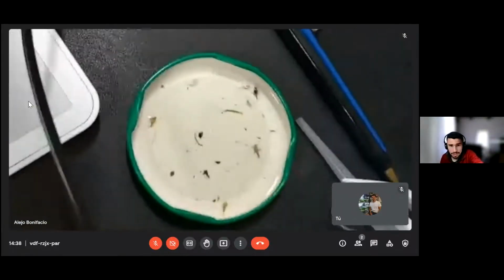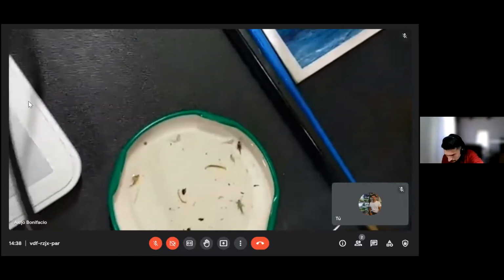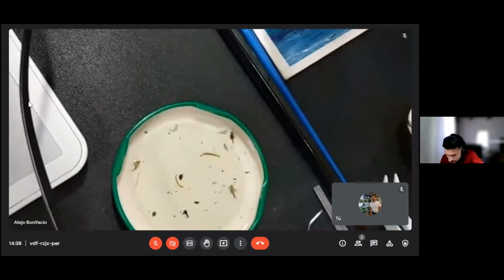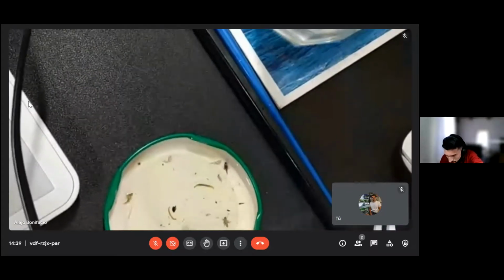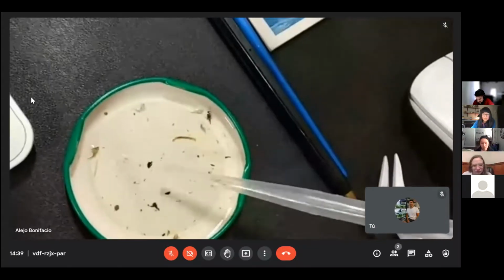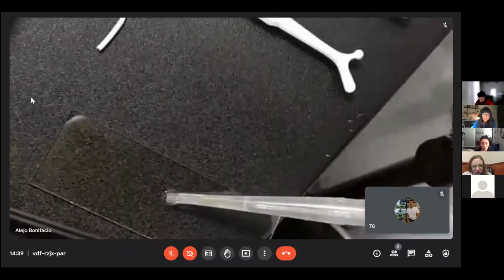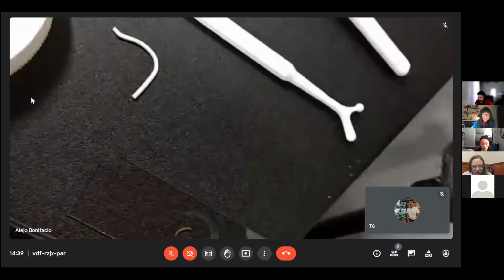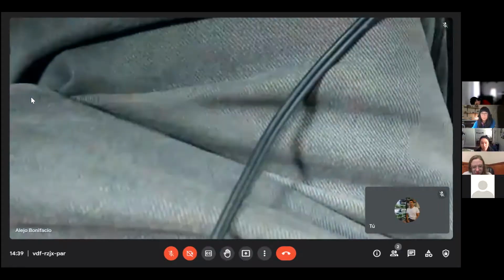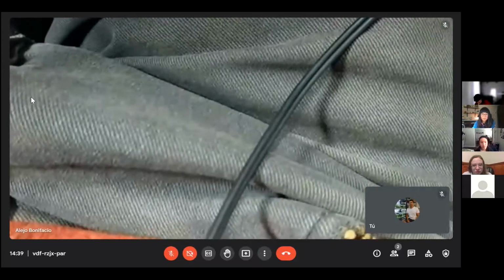These animals are preserved in ethanol, you know, and you will see that not all, but here there is a bloodworm. I'm going to put it right here to see how it looks. I have to turn on the microscope light to see it.